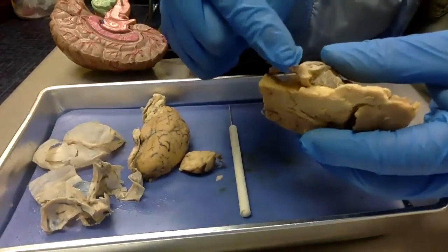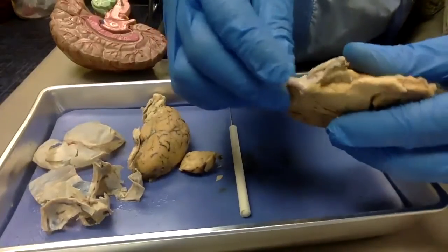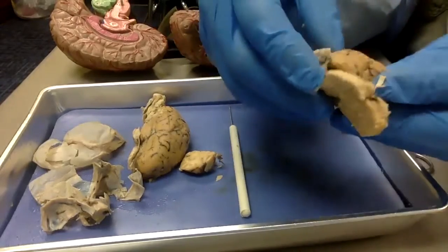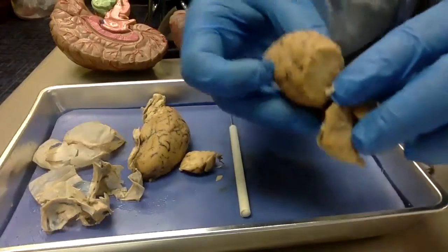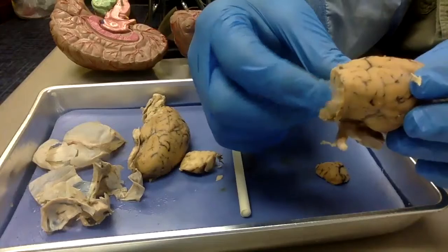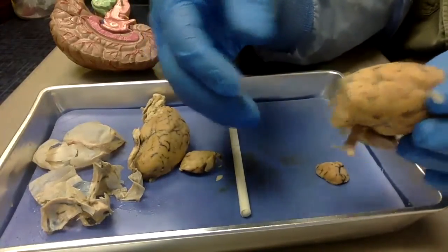As it comes in this way, this is the front, it continues to the back, because look at the angle. So the back of your brain is actually handling eyesight. And then this white matter is going to send that information to the front where you can process it and have emotions about what you're seeing.